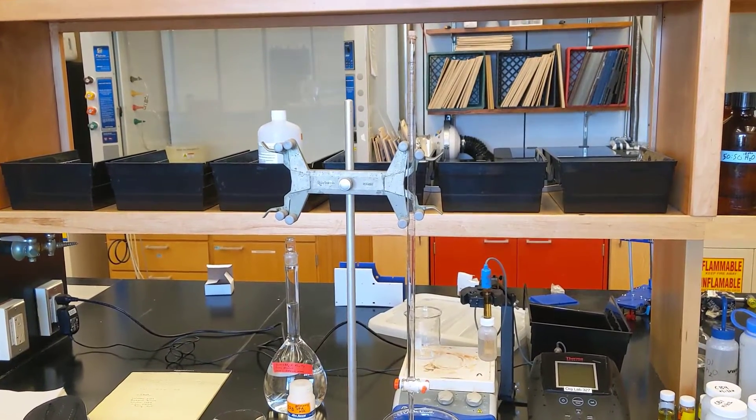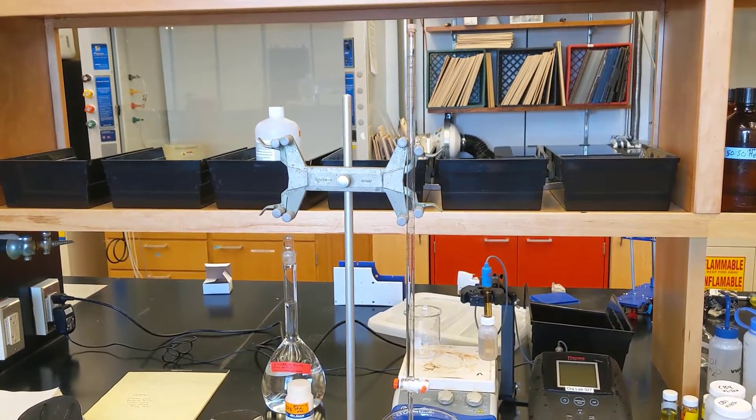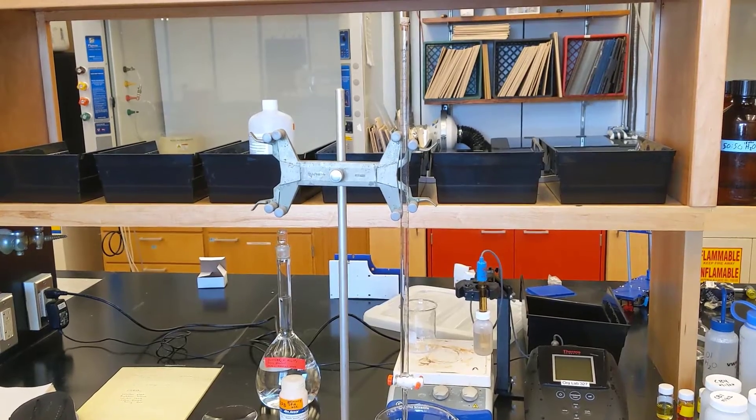All right, this is a quick tutorial on how to set up your burette for any sort of titration.